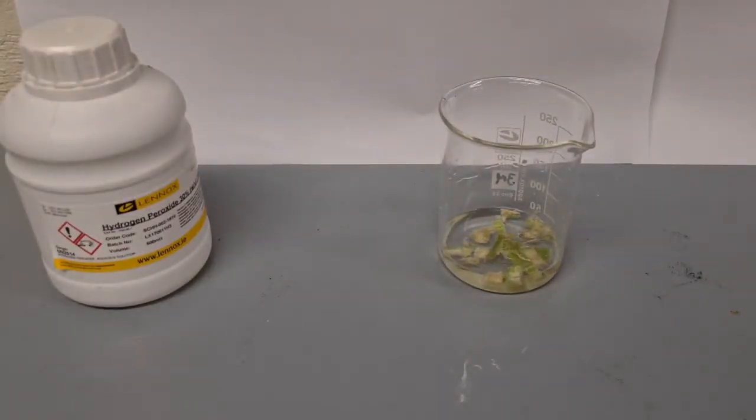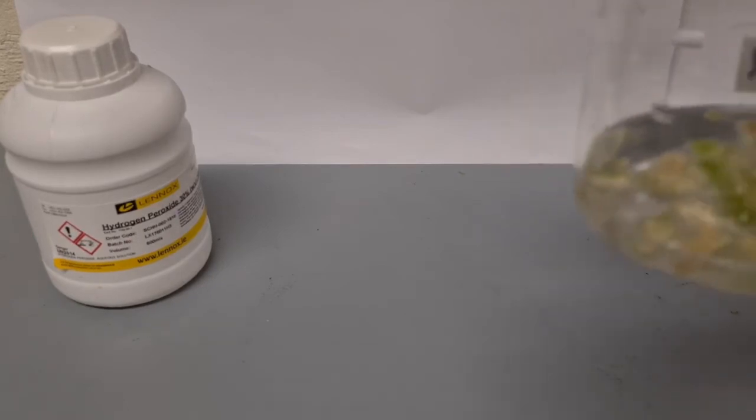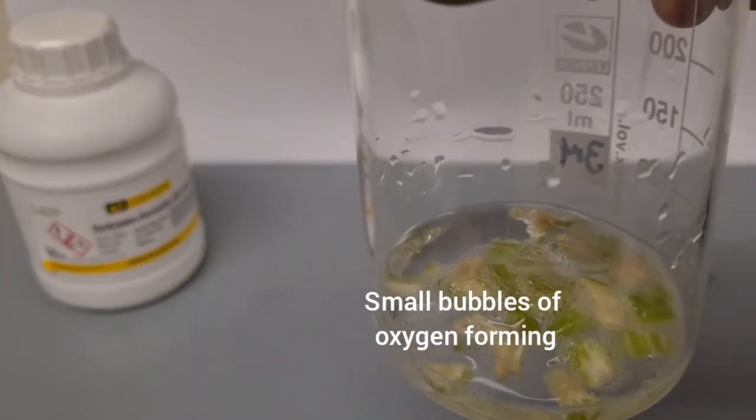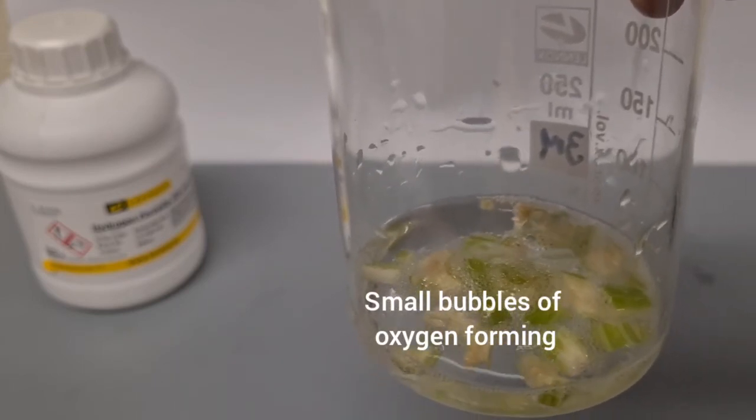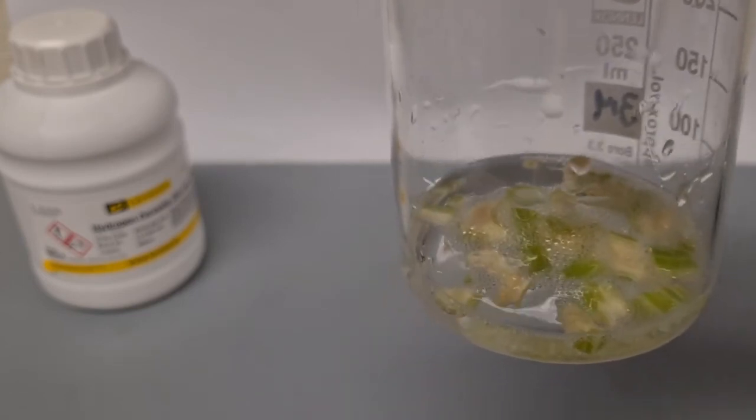This is a slower reaction but a reaction is occurring. We can see bubbles forming around the celery. Oxygen bubbles are being formed.